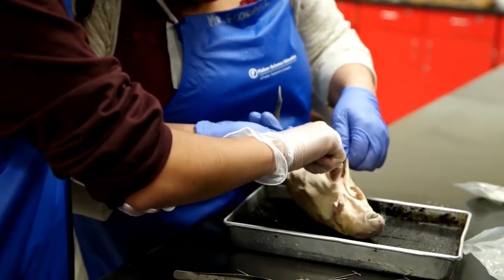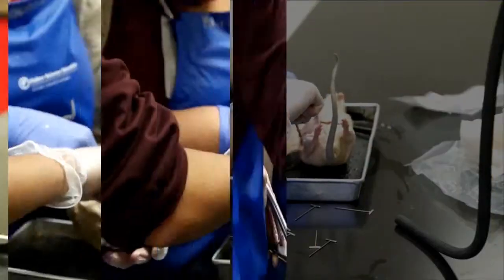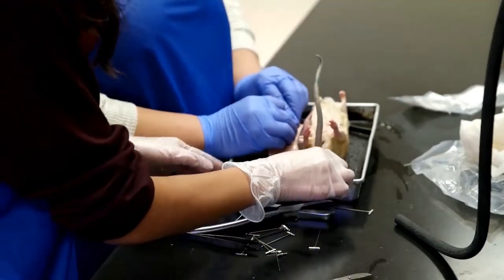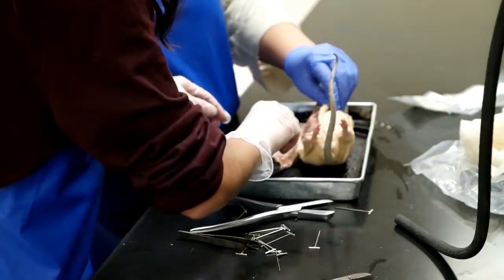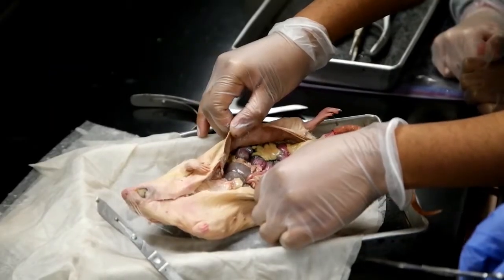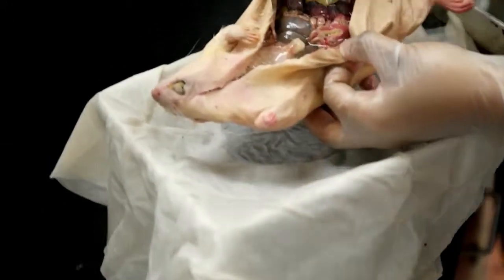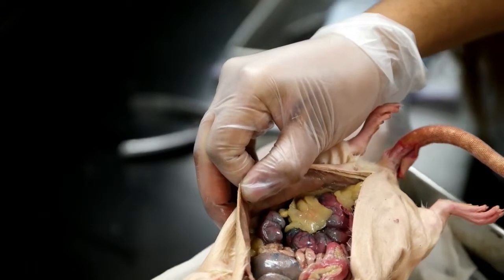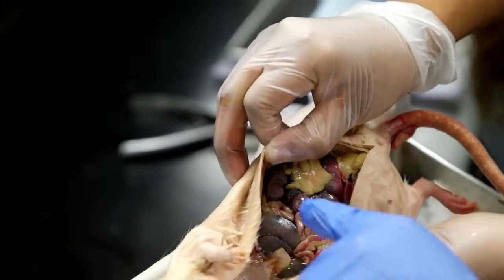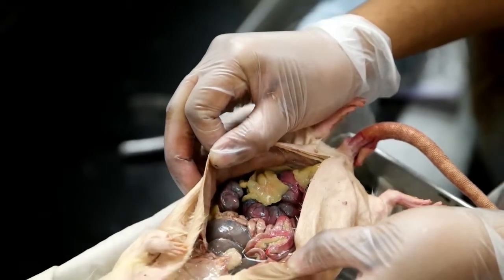We're supposed to cut it off. Can you bring it closer to the camera? So basically that's what's inside the rat. I don't see any baby — where's the baby? Oh, they look like grapes, right? They look like grapes. You might want to rinse that rat; it's got too much water.